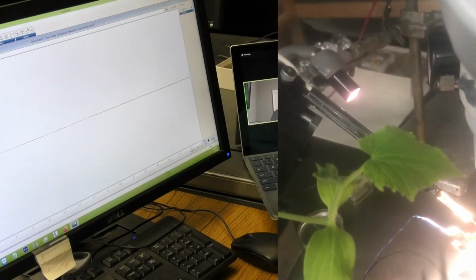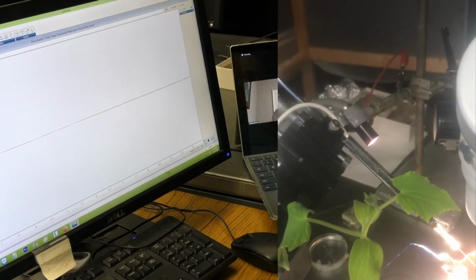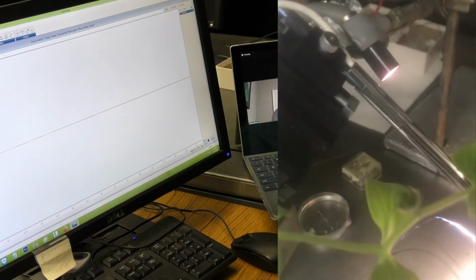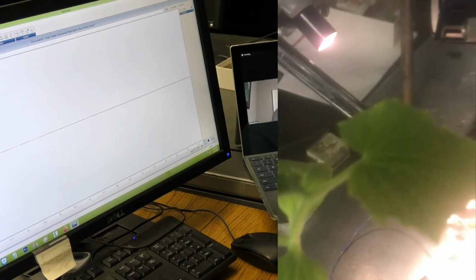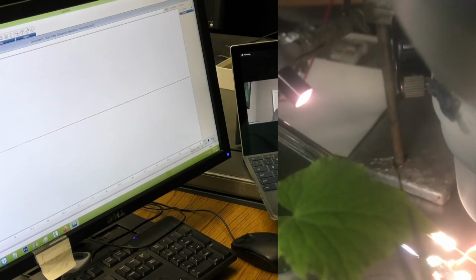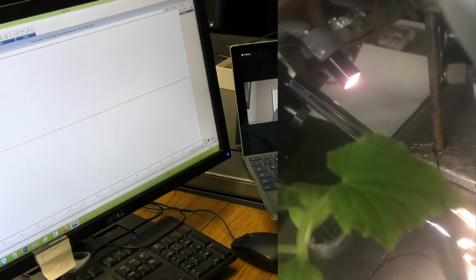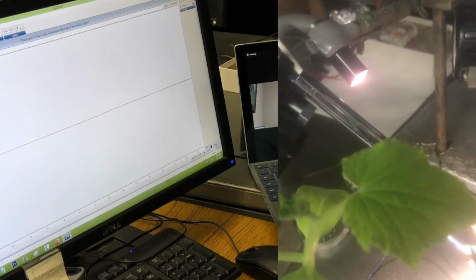And it's separated. You cut the bridge? Yes. Okay, so now, plant on the other side. We'll cut this leaf way up here we haven't cut yet. Over here. Let me get a good shot on this. Camera's not in focus. Okay, ready, get set, go. There's a good cut. I don't have anything on the computer screen. Okay. And that was a good cut.